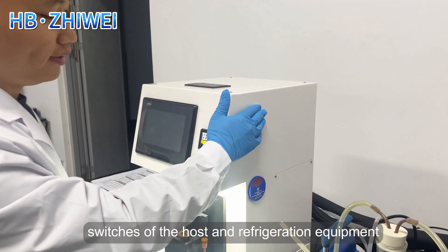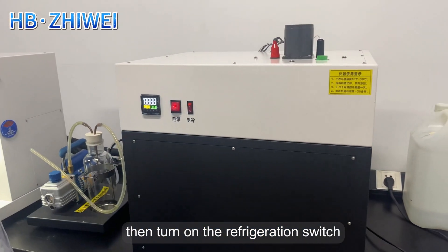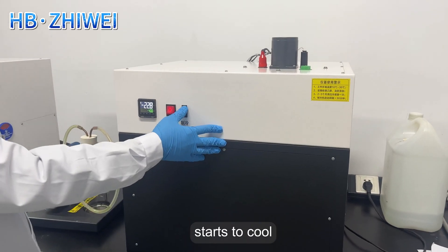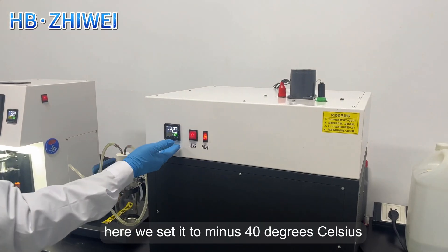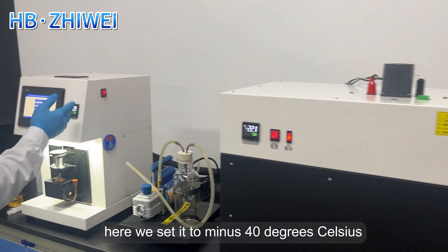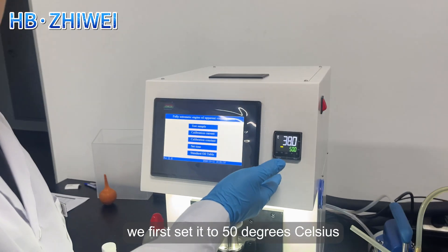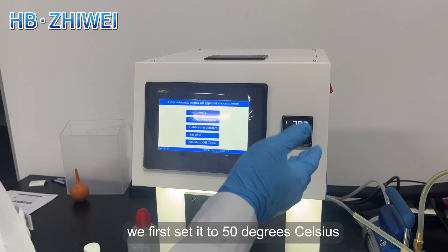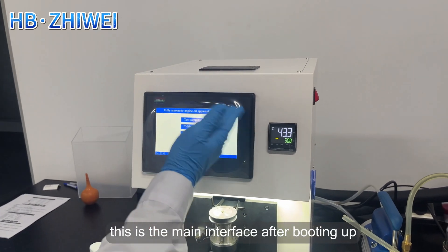Turn on the power switches of the host and refrigeration equipment, then turn on the refrigeration switch. The refrigerator starts to cool and stops automatically when it reaches the preset temperature. Here we set it to minus 40 degrees Celsius. In the temperature display area of the host, we first set it to 50 degrees Celsius. This is the main interface after booting up.